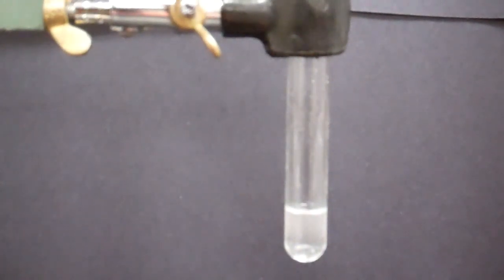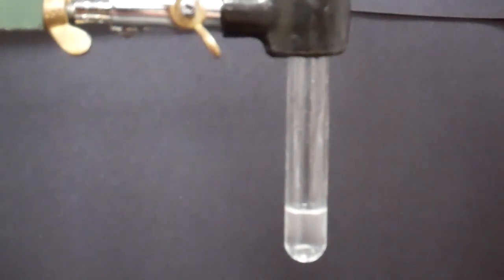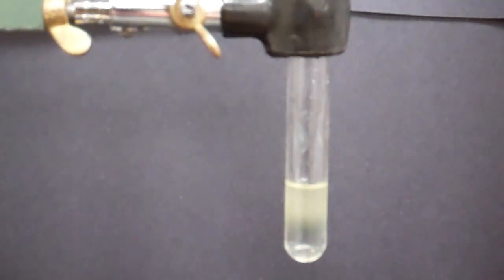After we get that dissolved, we want to add in our iron sulfate. We want to add in 10 to 15 drops, and then we're going to stir to mix this.